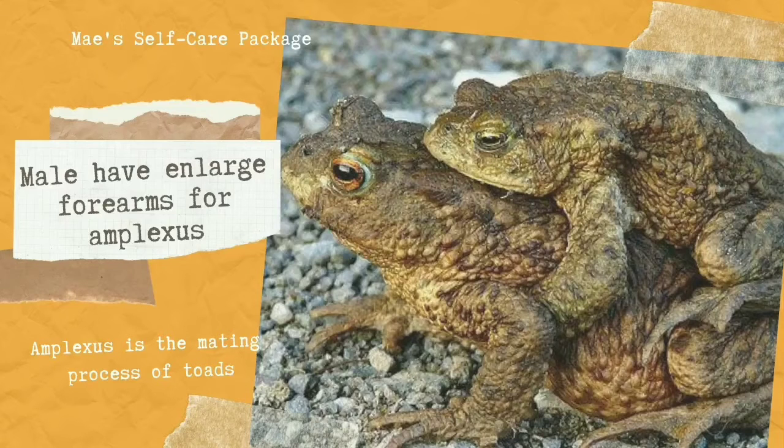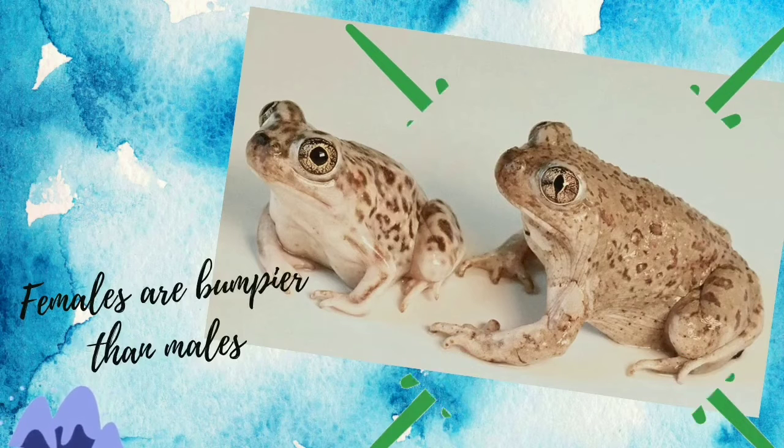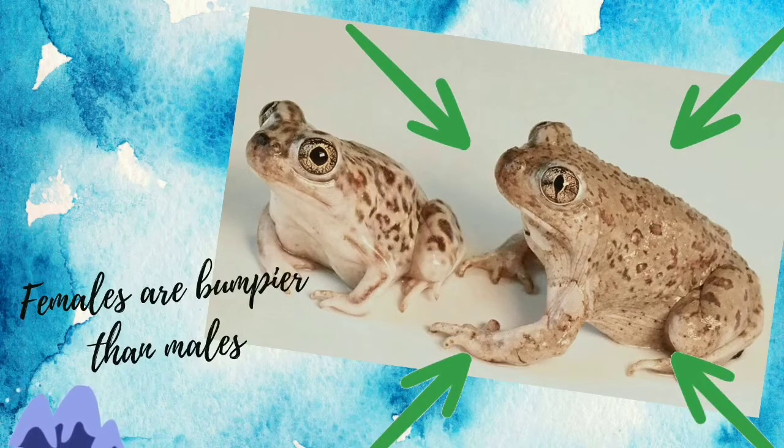During the breeding season, male toads develop enlarged forearms, which helps them to clasp females for amplexus. Amplexus is the mating process of toads. Females are also significantly bumpier than males, with a lot of warts on them.